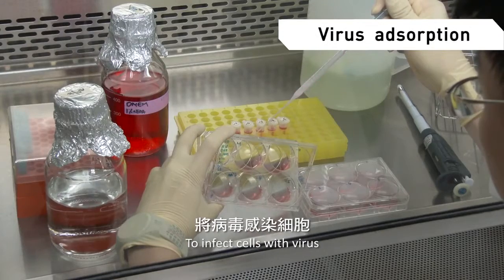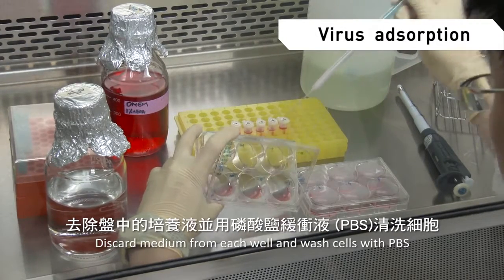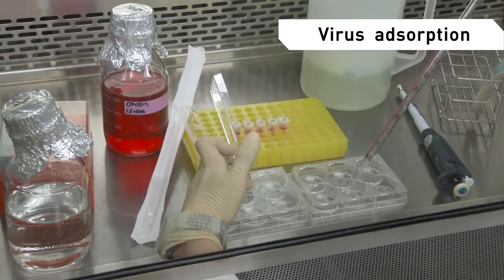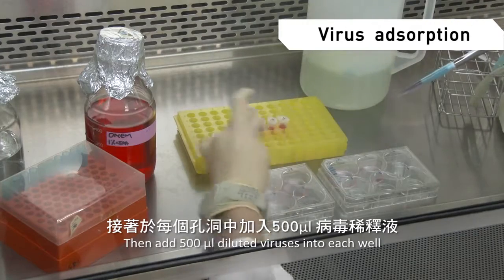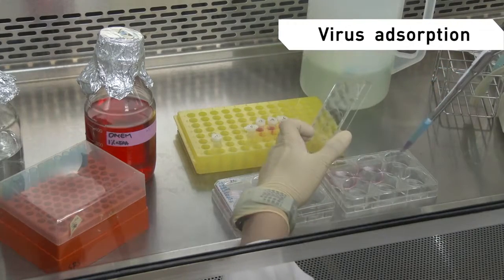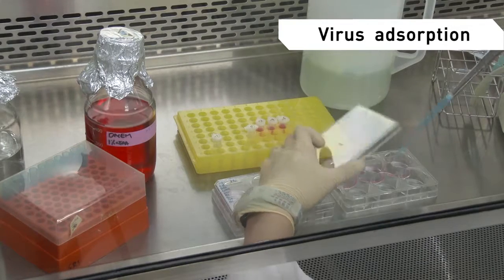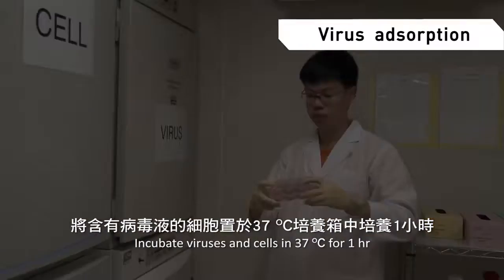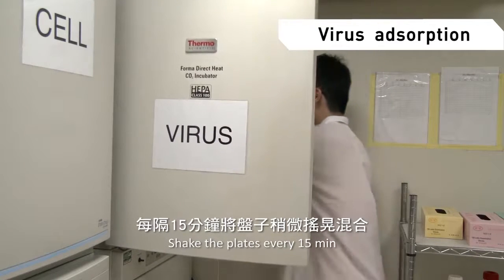To infect cells with virus, discard the medium from each well and wash the cells with PBS. Then add 500 microliters of diluted virus into each well. Incubate viruses and cells at 37 degrees Celsius for 1 hour. Shake the plates every 15 minutes.